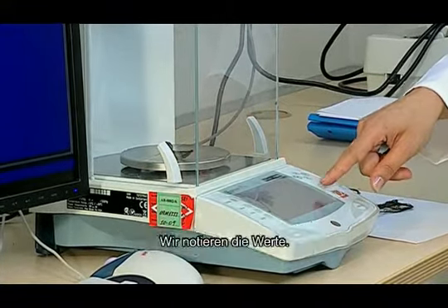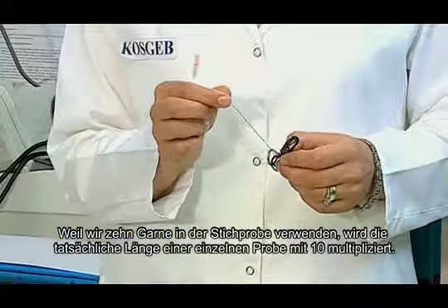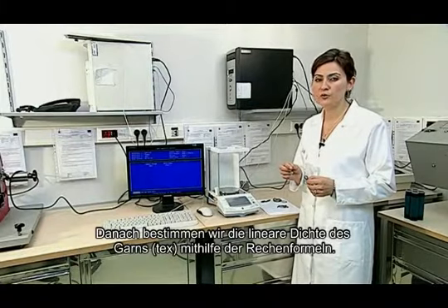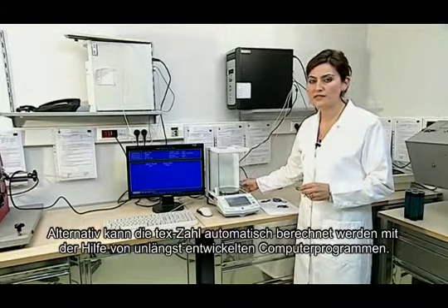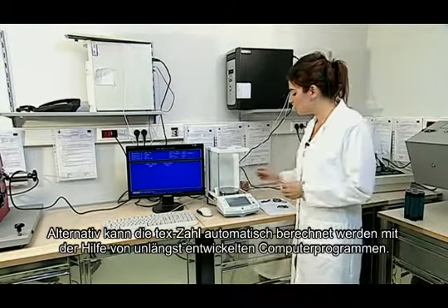Since we use 10 yarns in the sample, a single sample's actual length is multiplied by 10. Then we find the linear density of the yarn in tex by using the formula. Alternatively, the tex number can be calculated automatically with the help of recently developed computer programs.